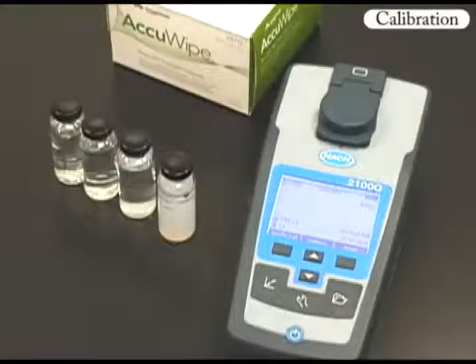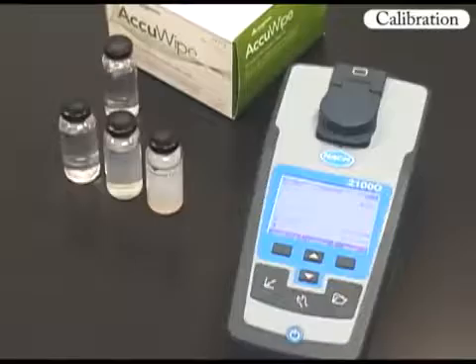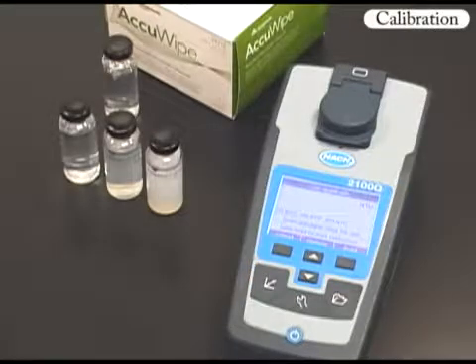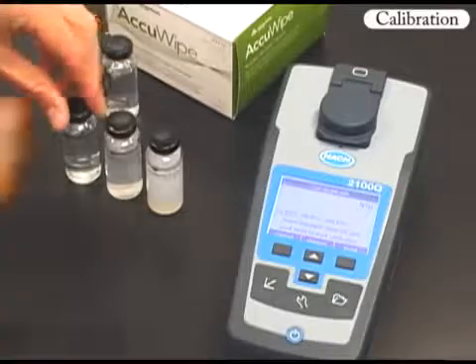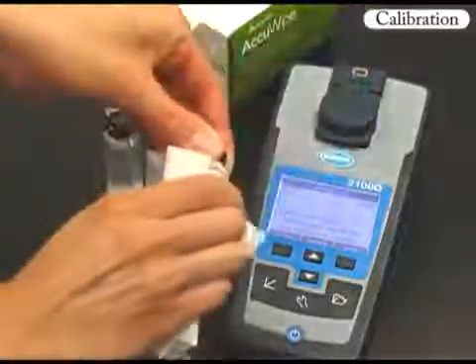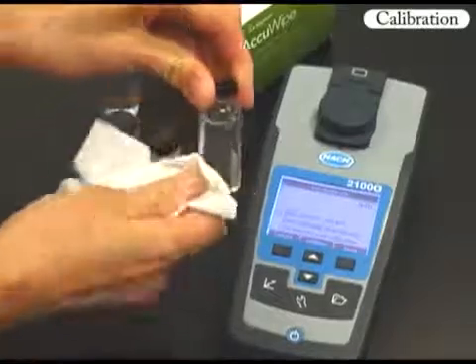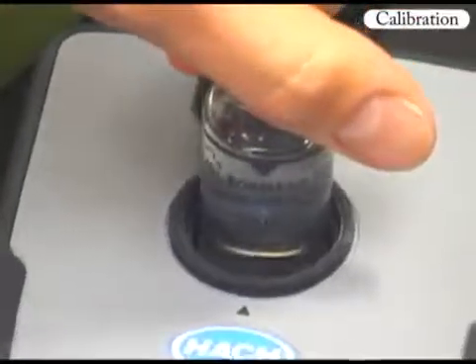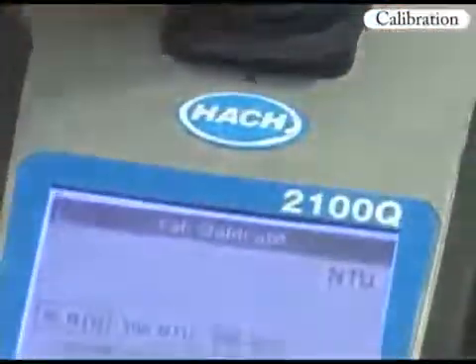For measurement of samples above 1 NTU, it is not necessary to prepare the calibration vials with silicone oil. Press the calibration key and follow the instructions on the display. The instrument will guide you through the three-point calibration procedure. Carefully wipe each standard with a clean, lint-free cloth before inserting into the instrument, being careful not to touch the glass with your fingers. Insert the sample cell with the orientation mark aligned with the orientation mark in front of the cell compartment. Close the lid and press Read.